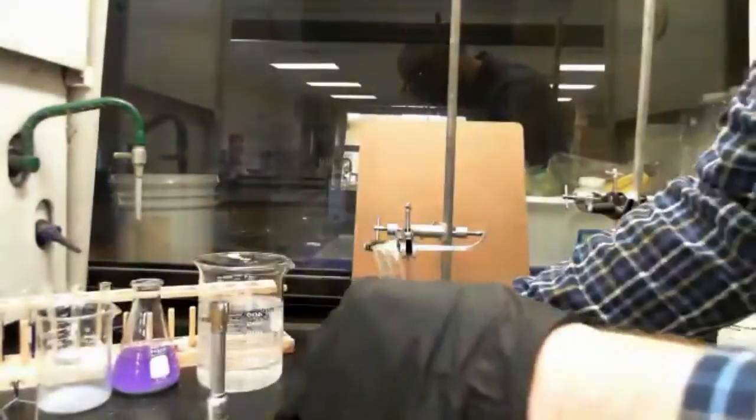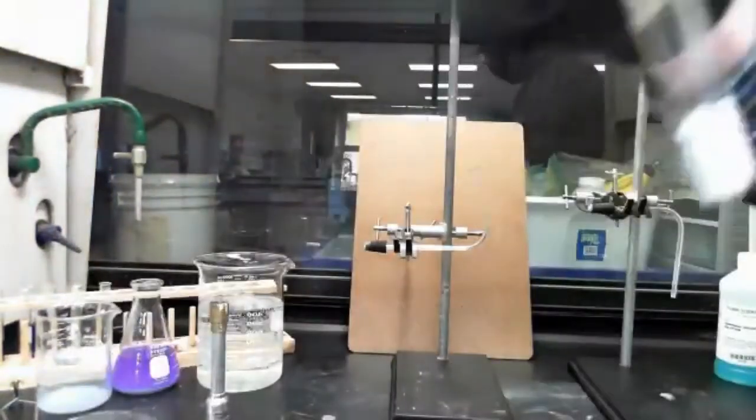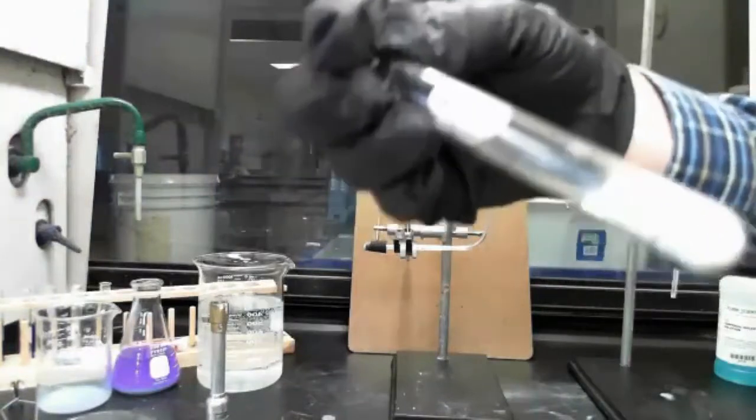That's all pre-made. Set that there. So now I have our reaction mixture in this test tube.